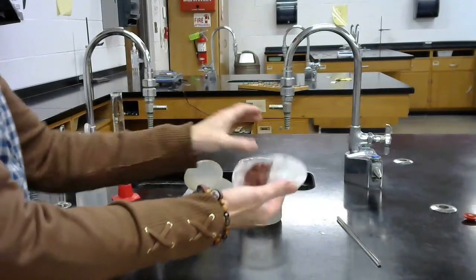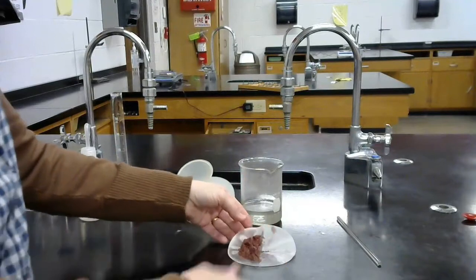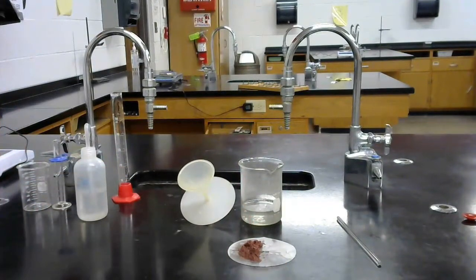We are not interested in that. We're interested in collecting this because it's a mass that we can use for calculations. So I will get that dry and then you can get the mass that was produced.